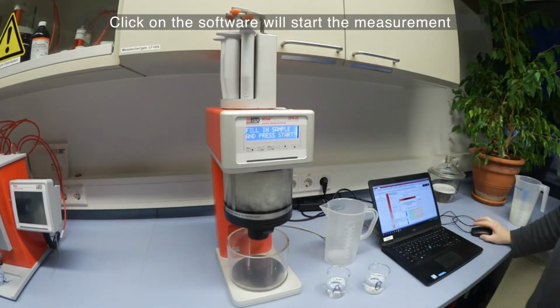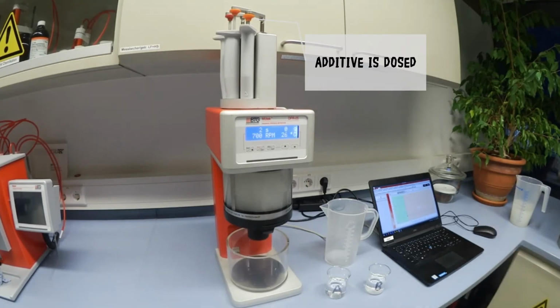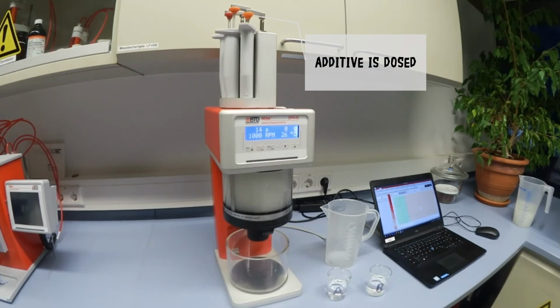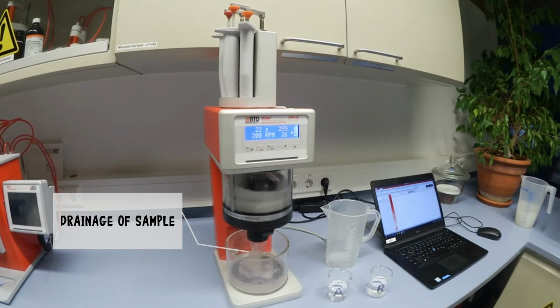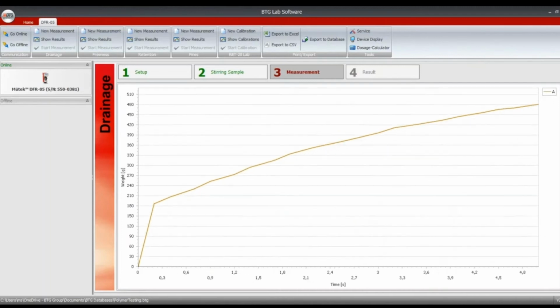Another click in the software will start the measurement. The DFR will work through the programmed stirrer profile. Mix the sample at 700 RPM, inject the additive after 5 seconds, and increase the stirrer speed to 1000 RPM to simulate shear forces. After the stirring, the chamber opens and the sample is drained over the inserted screen into the filtrate beaker on the balance.